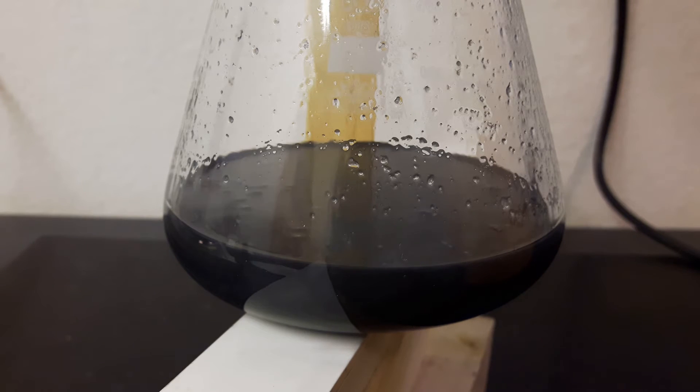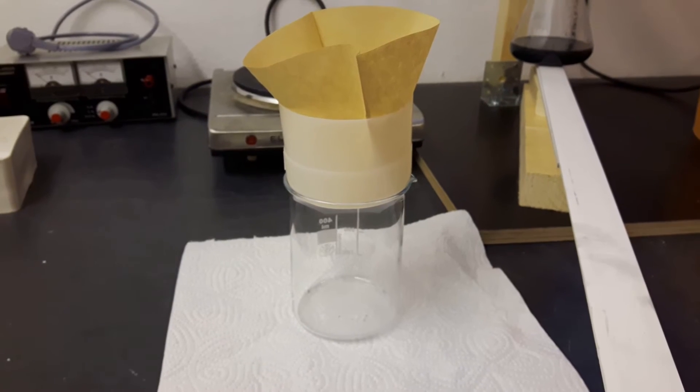But actually it turned out to be super stupid. Because not even a milliliter made it through the filter paper. So I ended up poking the filter paper with a screwdriver. Which resulted just in the loss of material. So this is insanely stupid.